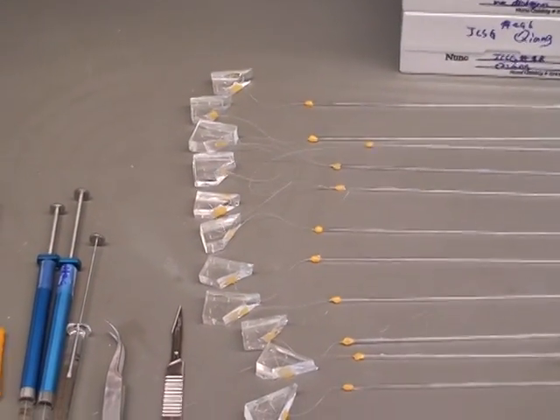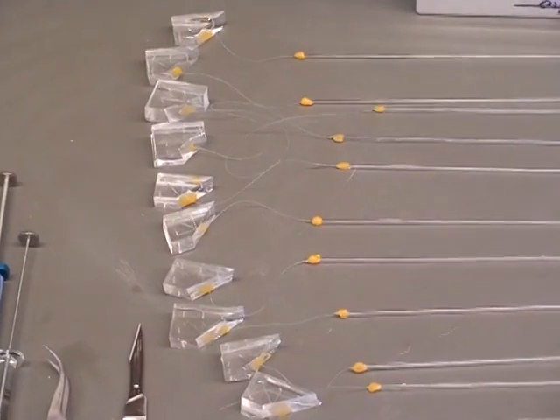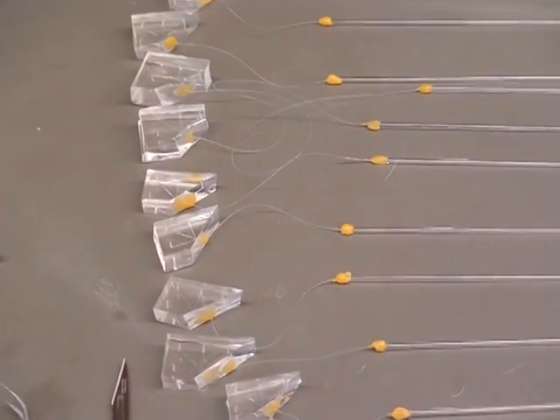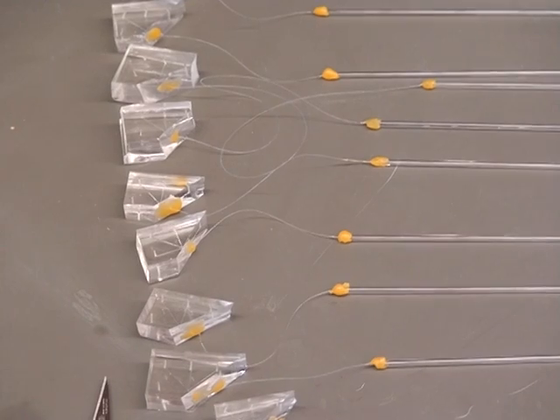And a series of PDMS devices, three inlet devices, which will be used to form plugs.